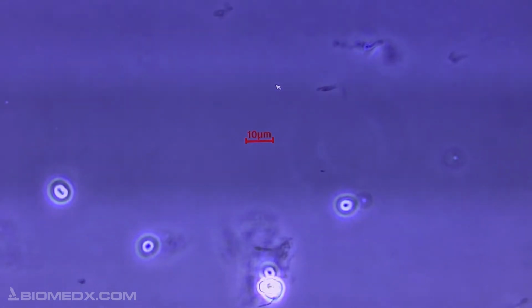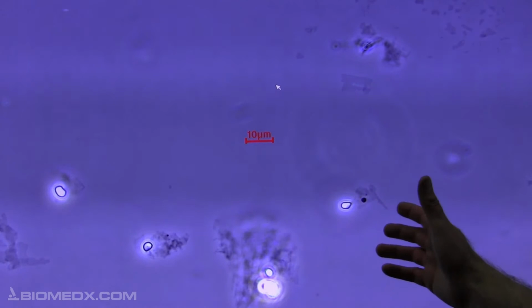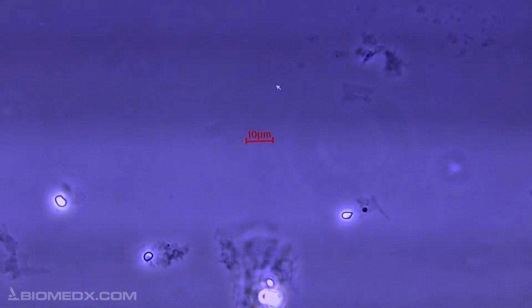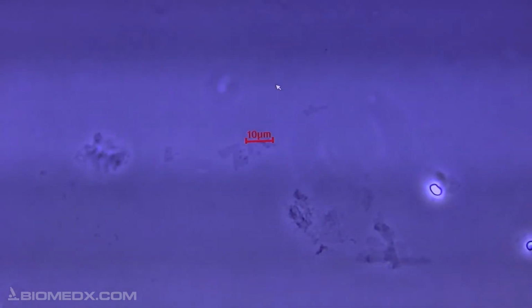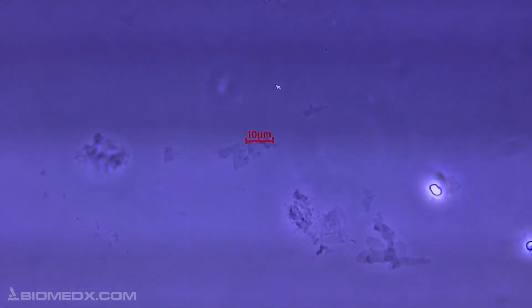Now this is a 40x non-oil objective, so I usually put things up on here first just to check it out. But as I pan along, that may be a liposome right there, but it's not moving, so maybe it is not. But there is debris. See this debris right here? I'll zoom in on that. I guess I don't need to zoom in on it. I just looked at the camera here. So anyway, I saw this. I thought, where are the liposomes? So that's when I pulled out the other product in the refrigerator.